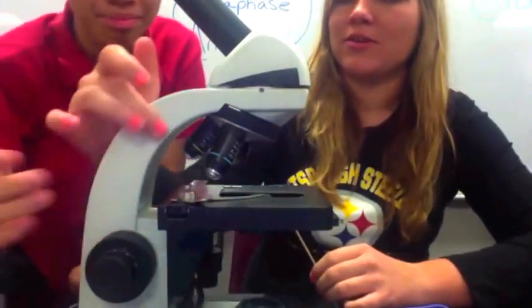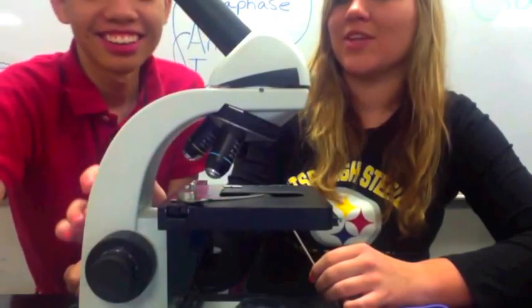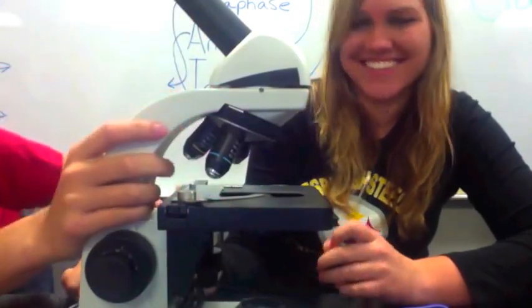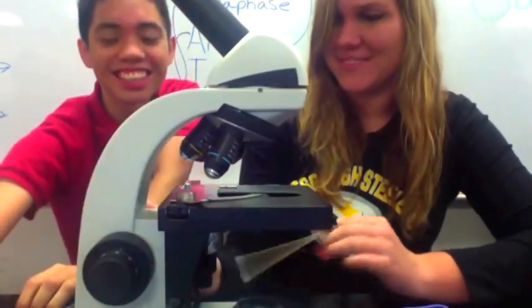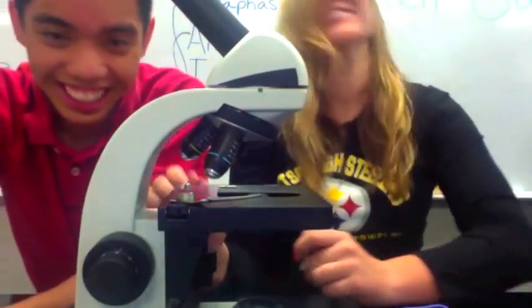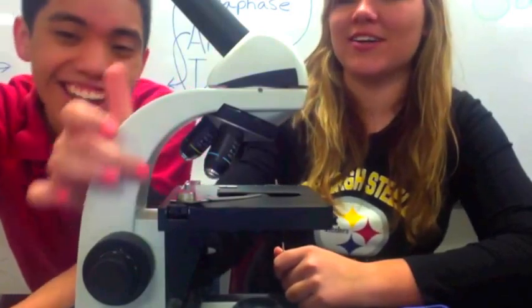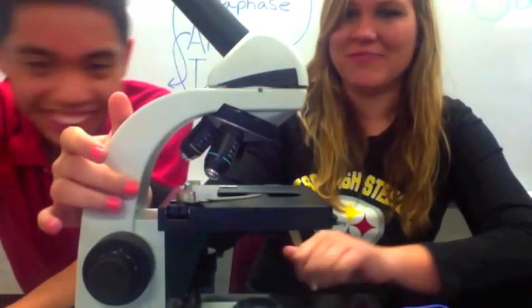This part of the microscope — and this is a trick question, TAs will do this — is called the arm. Not the neck: the arm. Watch out for trick questions like that on the exam.